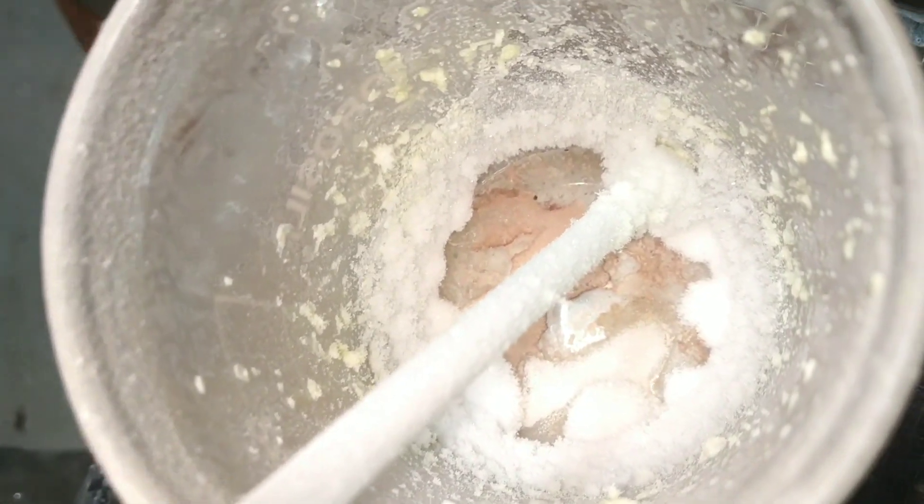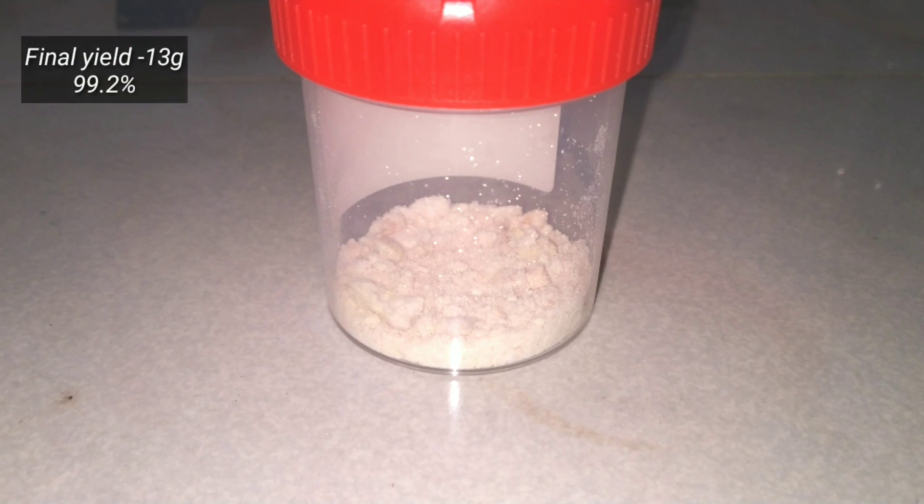After letting everything cool, I collected the solid product which weighed up to 13 grams. The yield came to 99.2%.